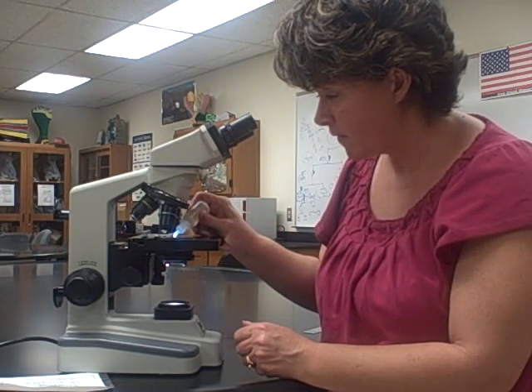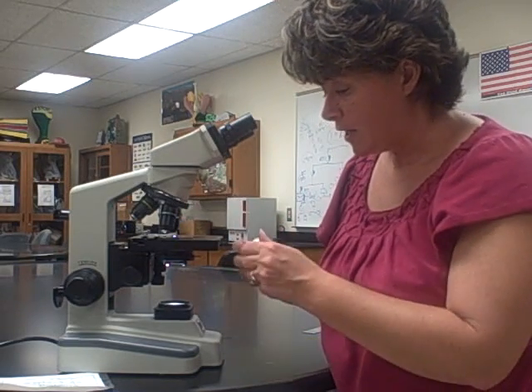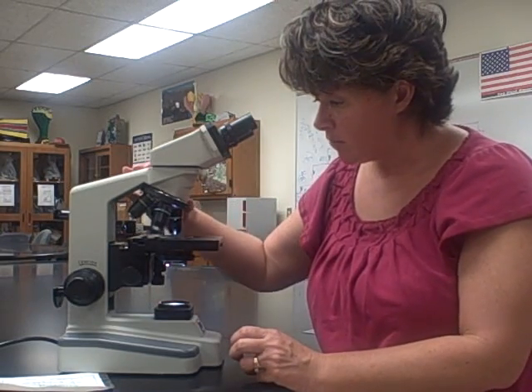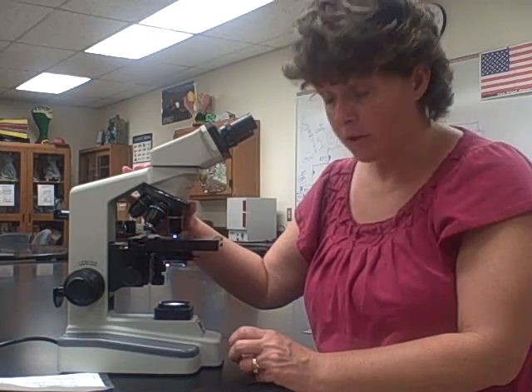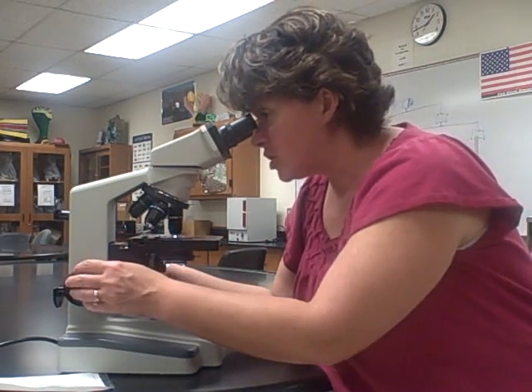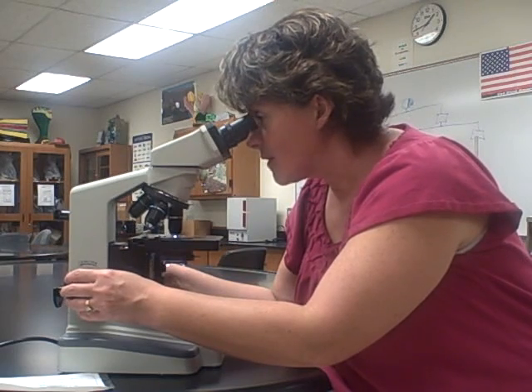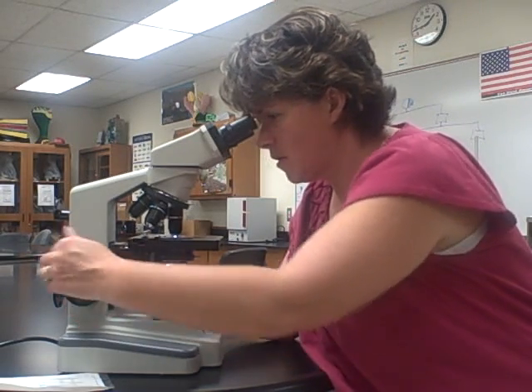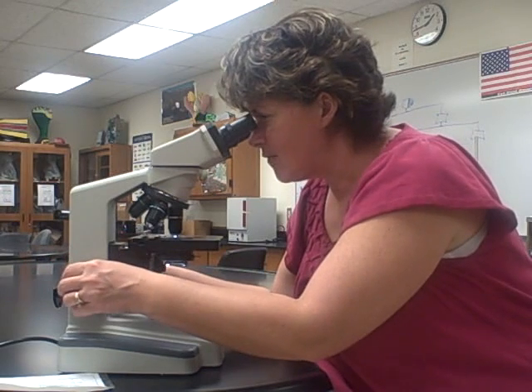I'm placing it between the objectives, then I add my drop of oil. You need very little oil, and you don't actually touch the slide with the bottle — just let the oil drop onto it. Now I move the 100x directly into the oil. It's really close and looks like it's going to hit, but if you're in focus it won't. Once again, only minimal fine adjustment can be used. What generally works is to focus away from you first — notice how I'm moving in that direction.